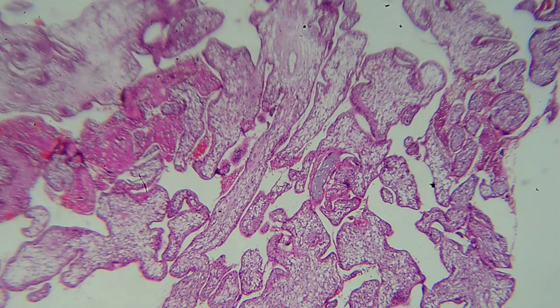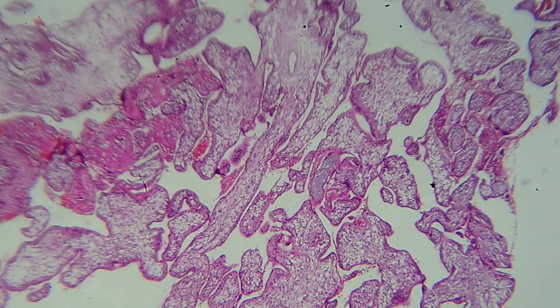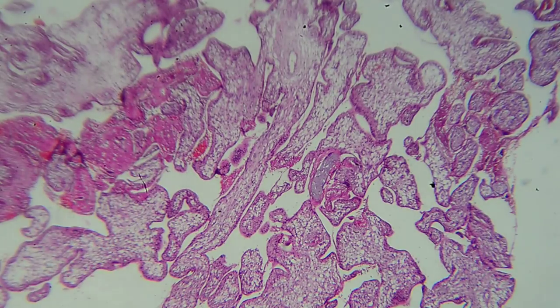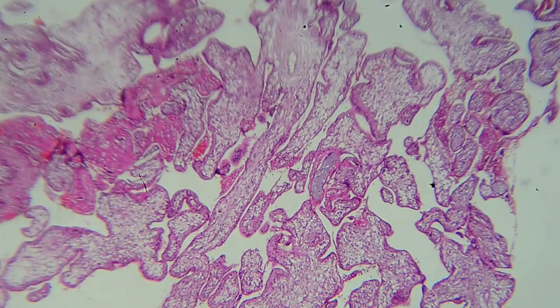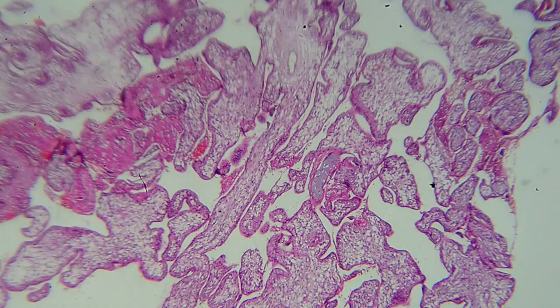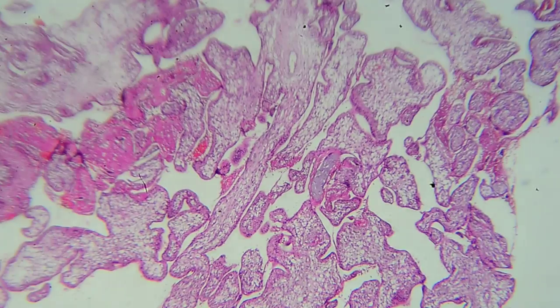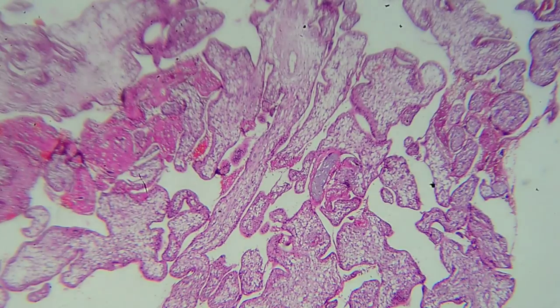This proves the patient was pregnant — this is embryonic tissue without a doubt. It was taken from the endometrium, either passed out to the vagina or scraped out during a procedure. All of this proves products of conception — the patient is either pregnant or had a recent abortion. These are just normal placental tissues.